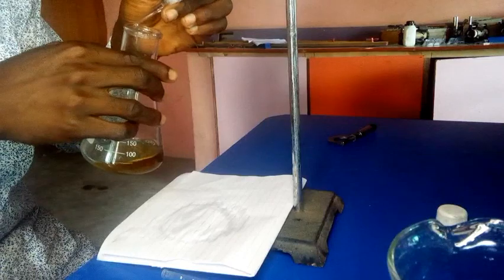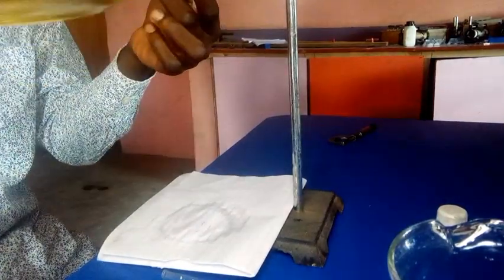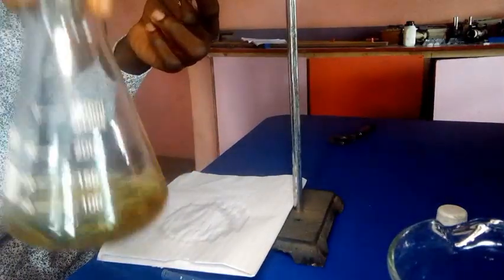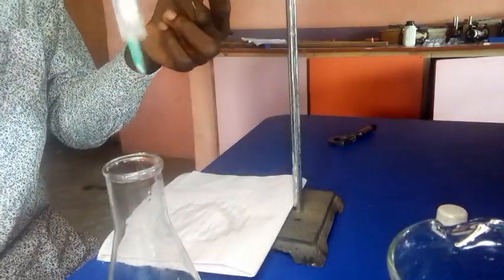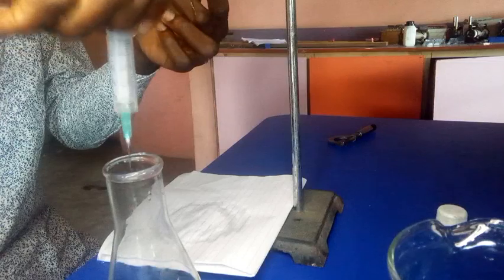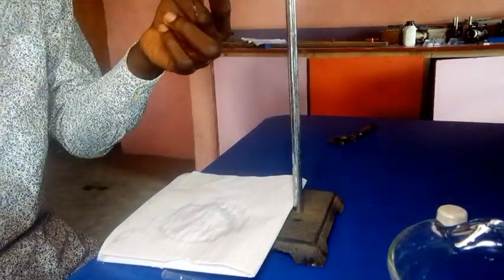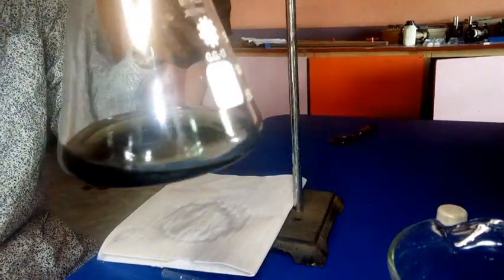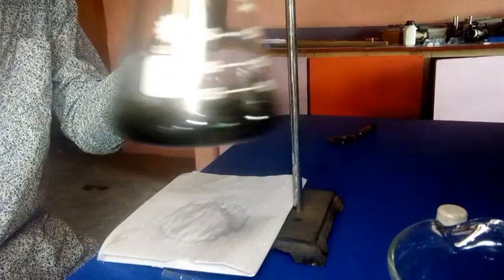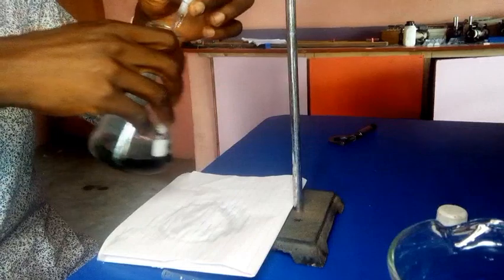So the next thing for us to do is to what? The next thing for us to do after observing a yellow color is to add a starch. So when adding the starch solution, you put a drop, a drop of starch solution. Let's see what happens to the solution. Good. After adding starch, we discover that the solution turns a kind of blue. Yeah, it turns dark blue. So we continue the titration until we have a colorless solution.